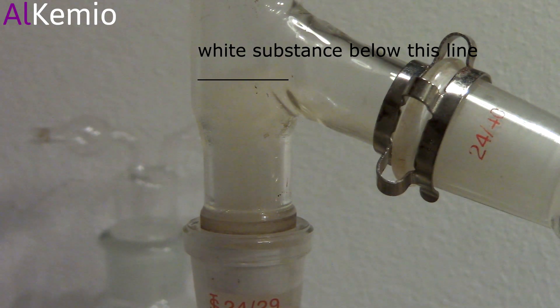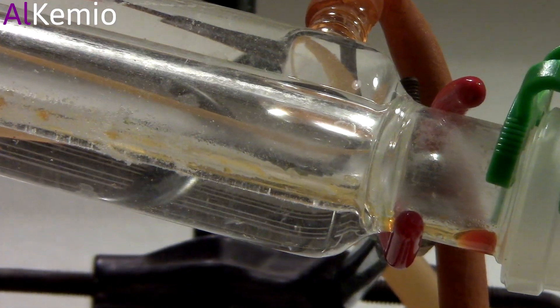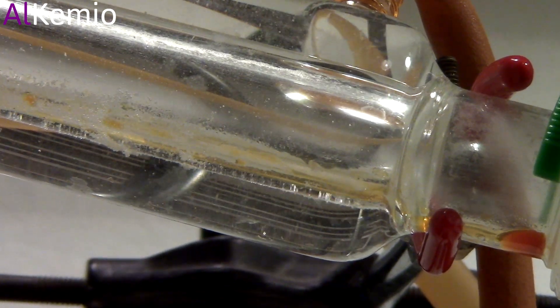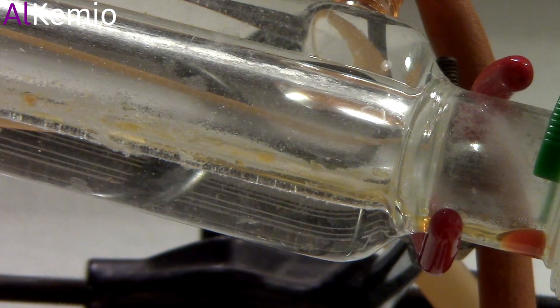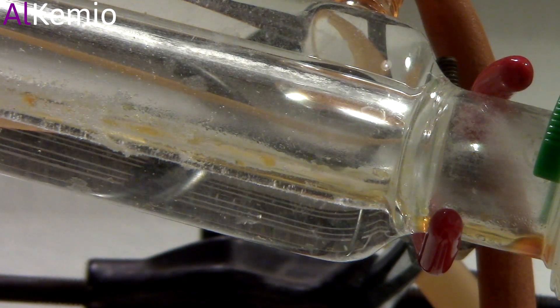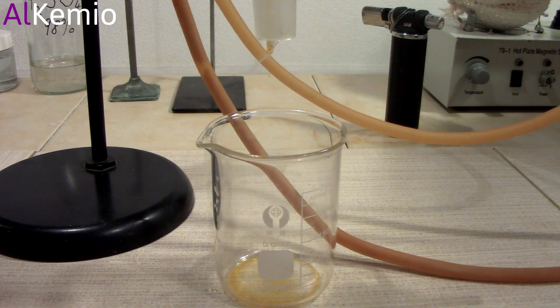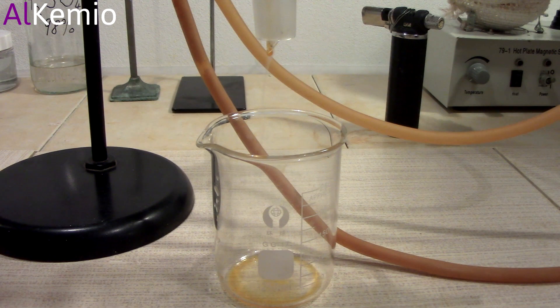I cranked up the heat and the thick benzene vapor started coming over. And here we have our first crude benzene.